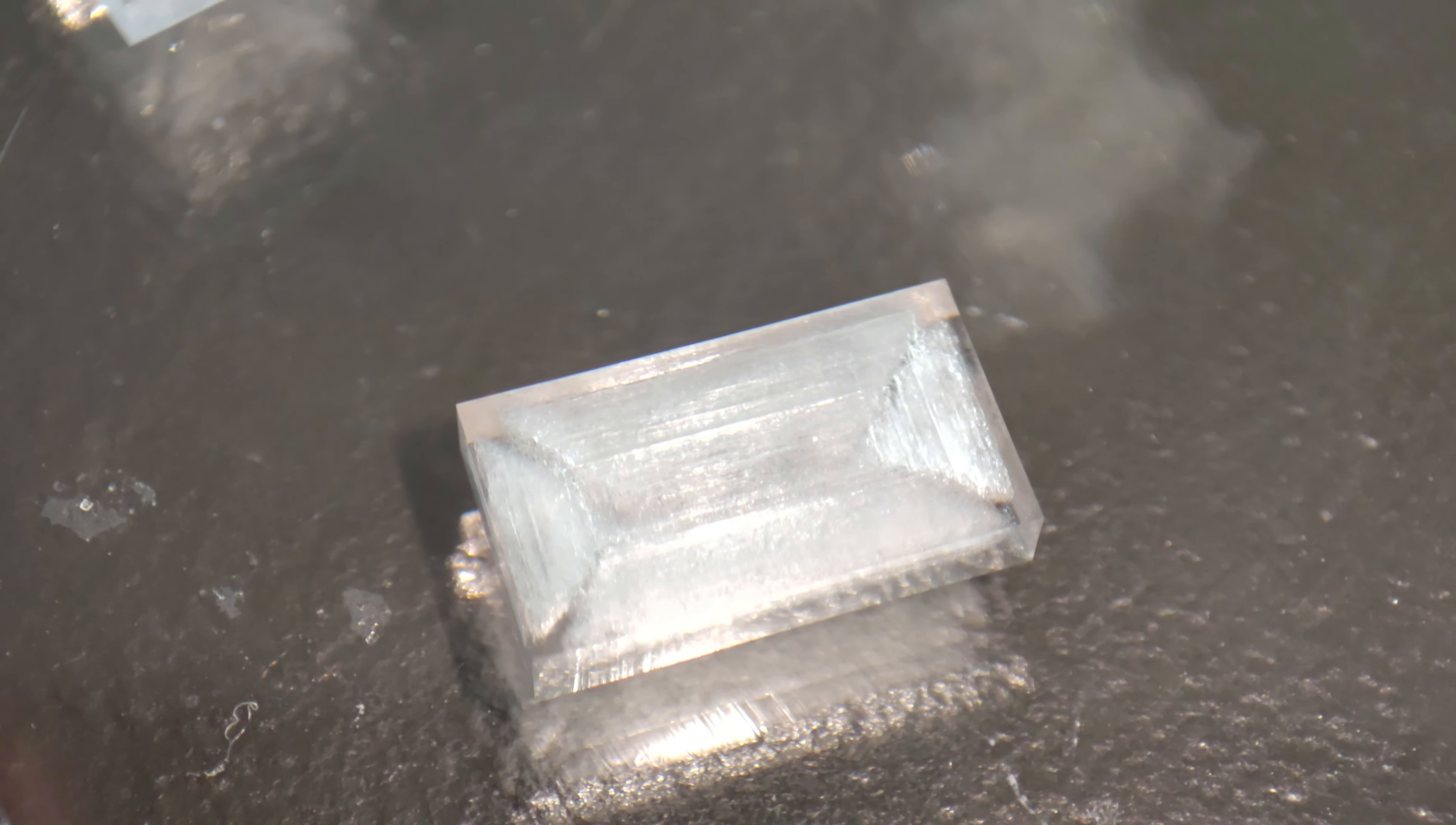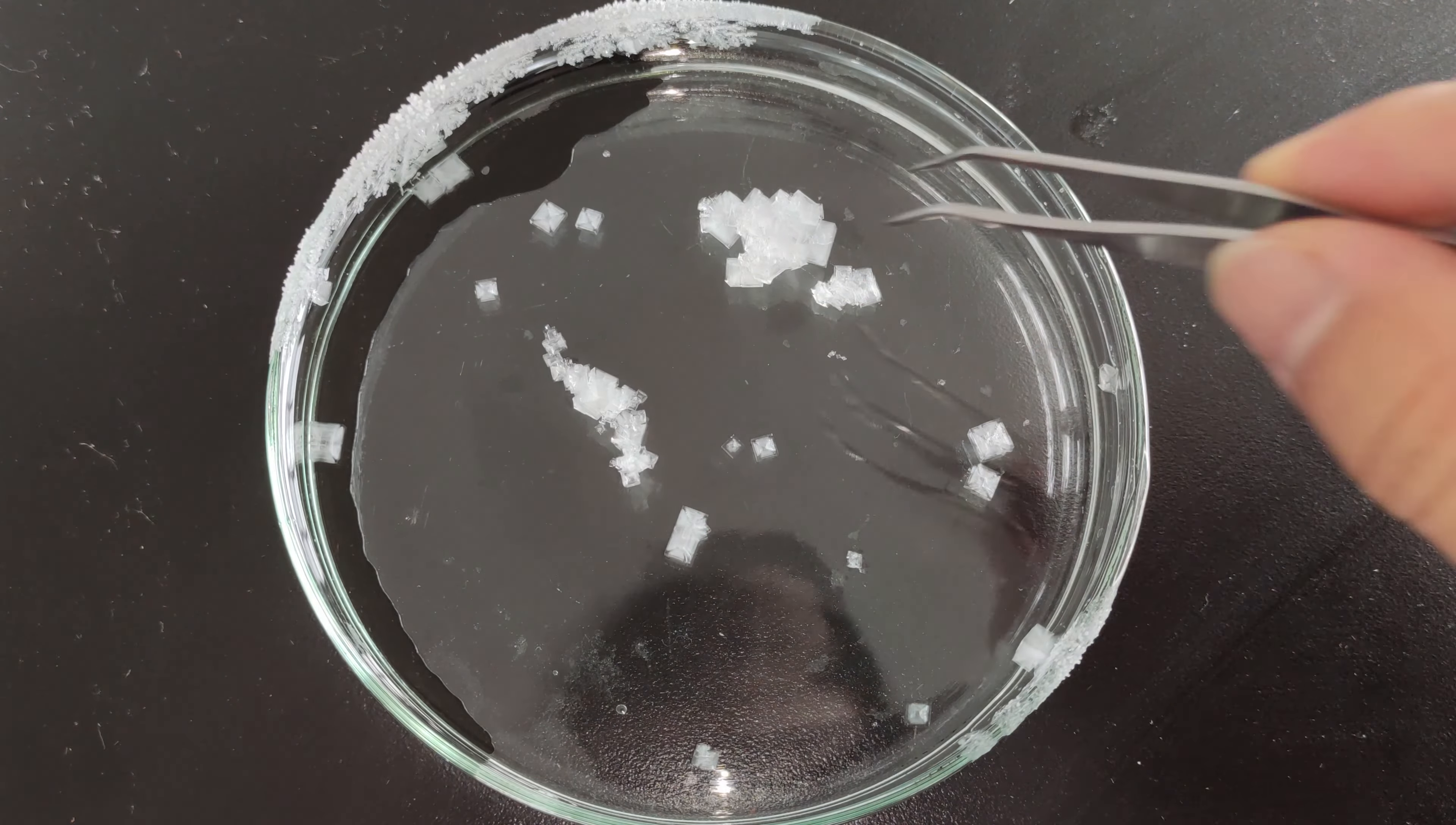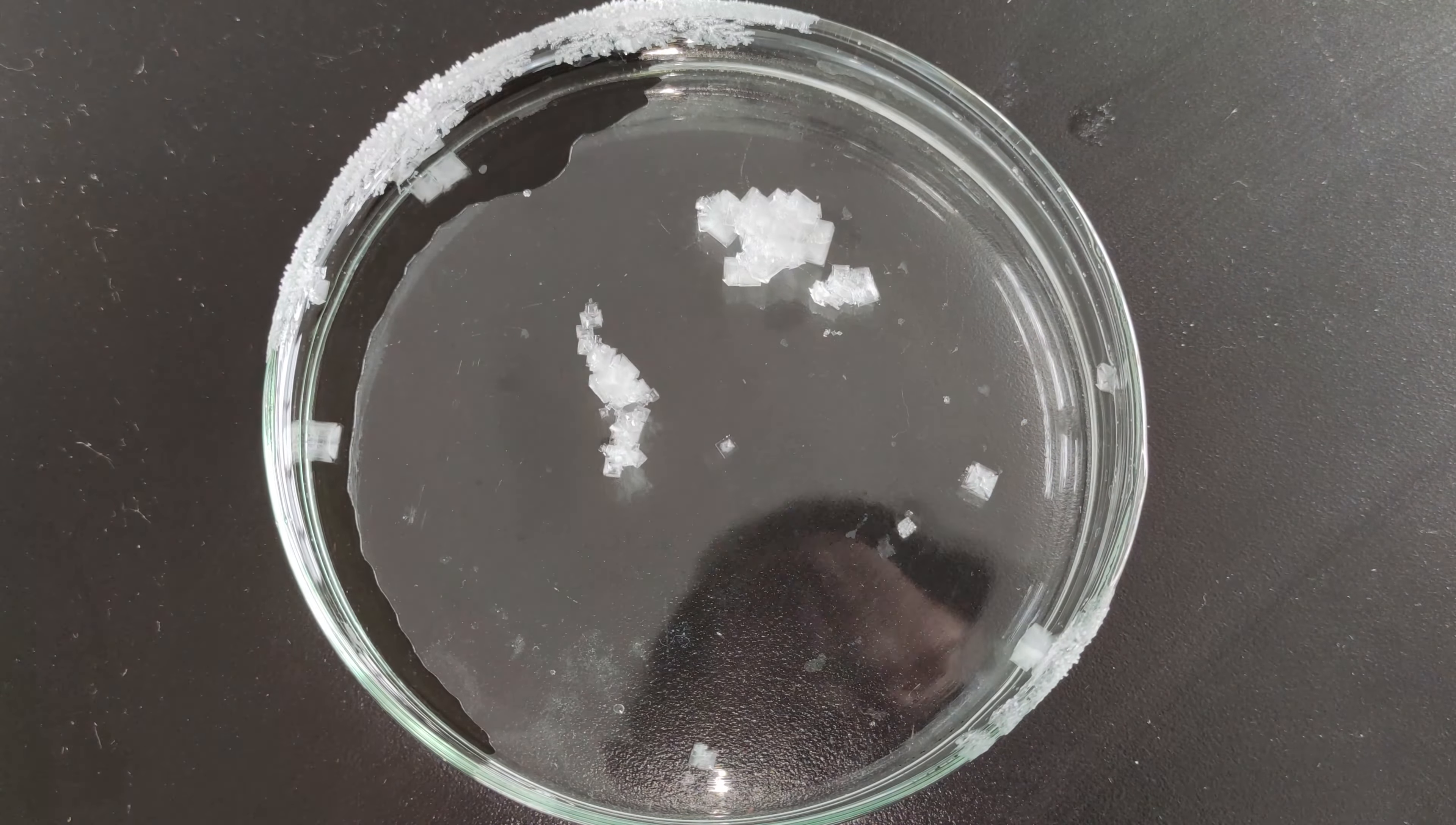Hmm, looks like our crystals are feeling a bit under the weather. Cloudy, you might say. But don't worry, we'll figure out how to give them some clarity.